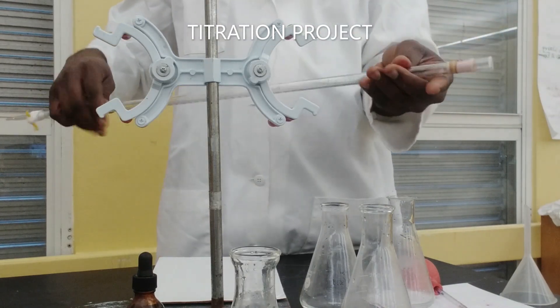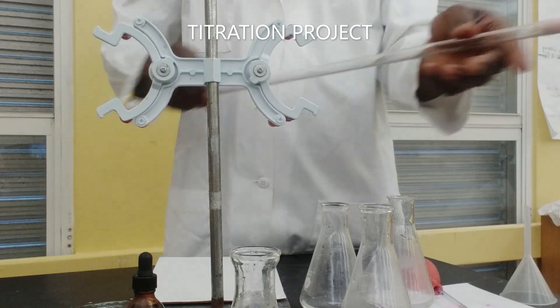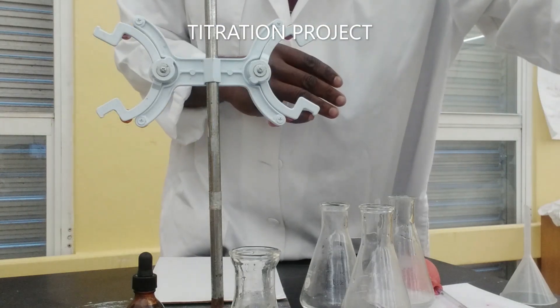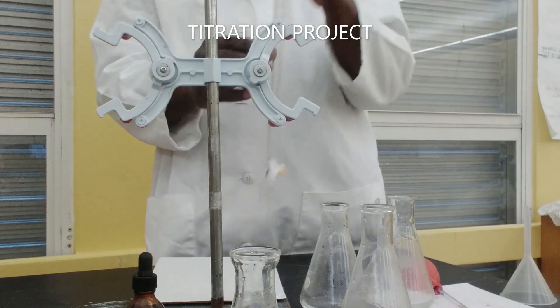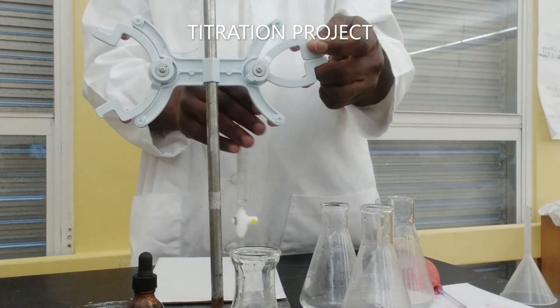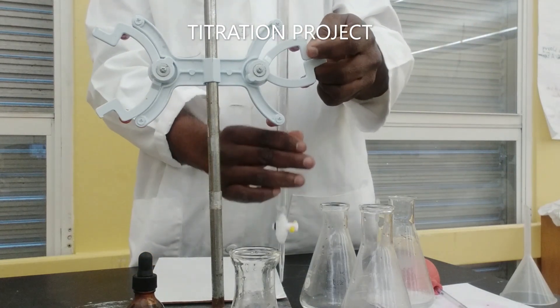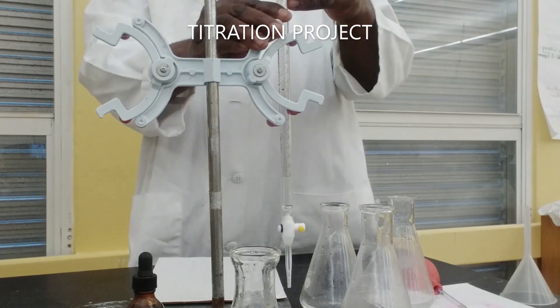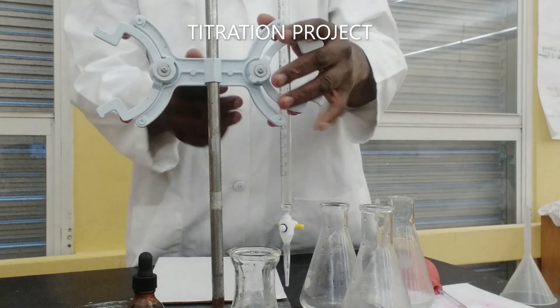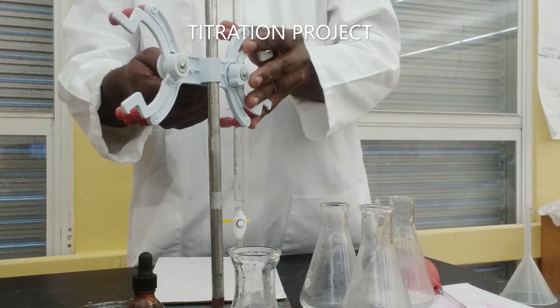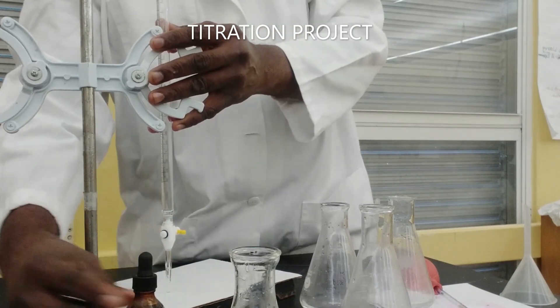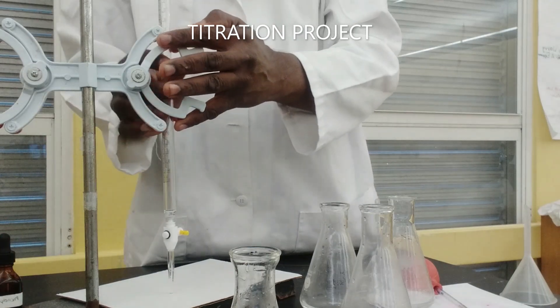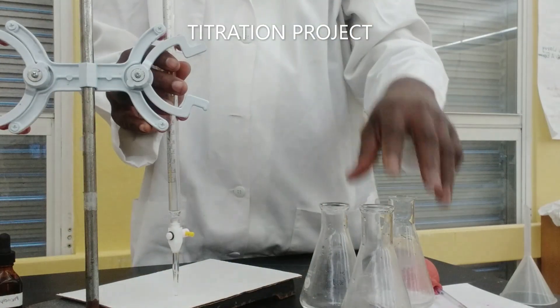I'm going to go ahead and rinse it out. Here I have a burette clamp, so I'm going to go ahead and clamp it. Just adjust this so that you can see what is going on. Get that out of the way.